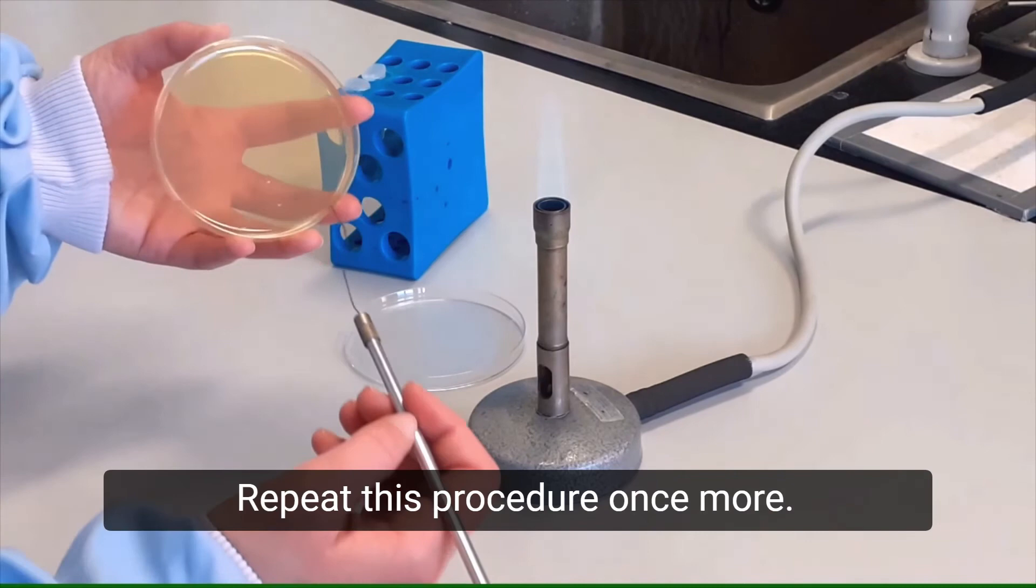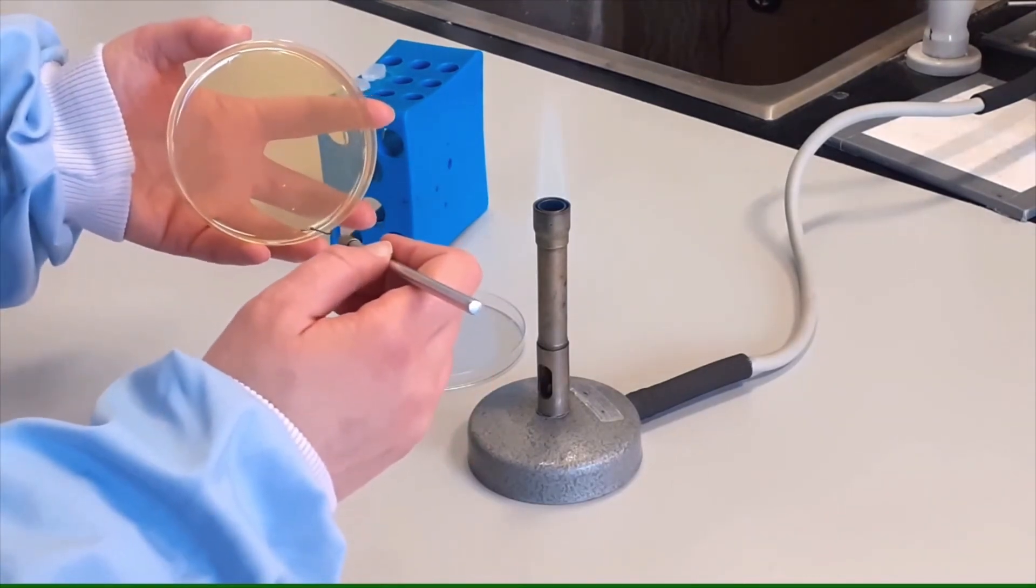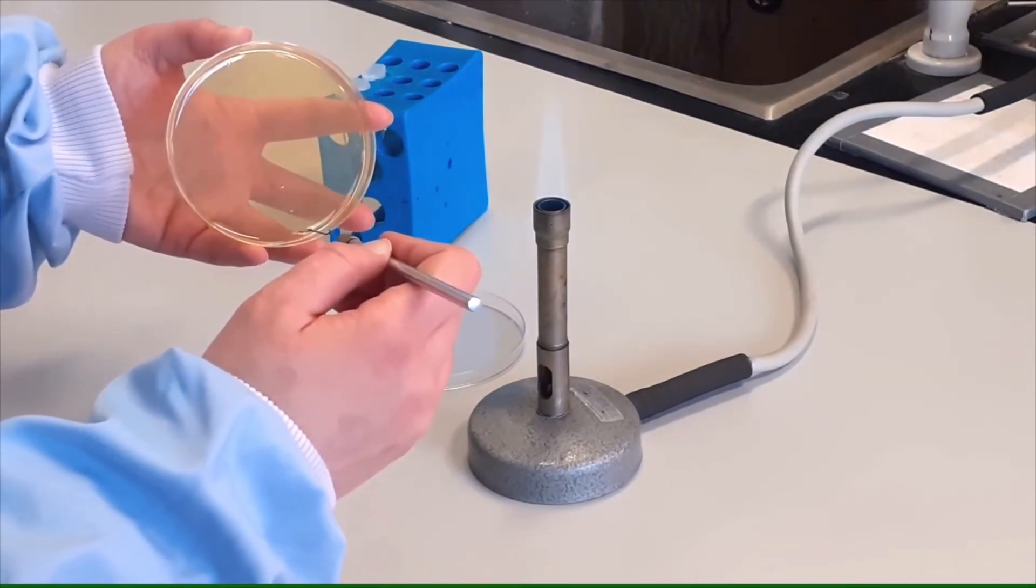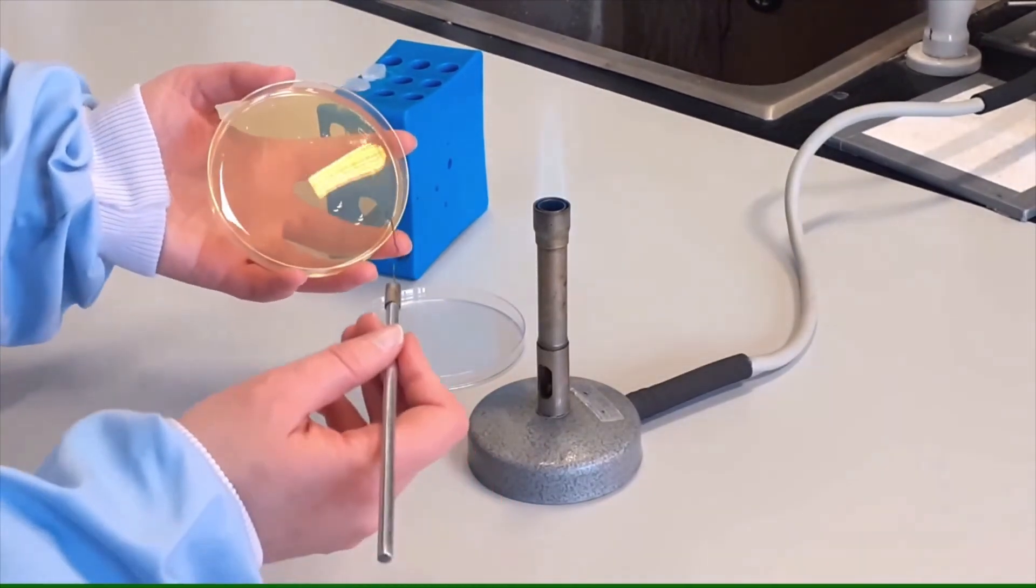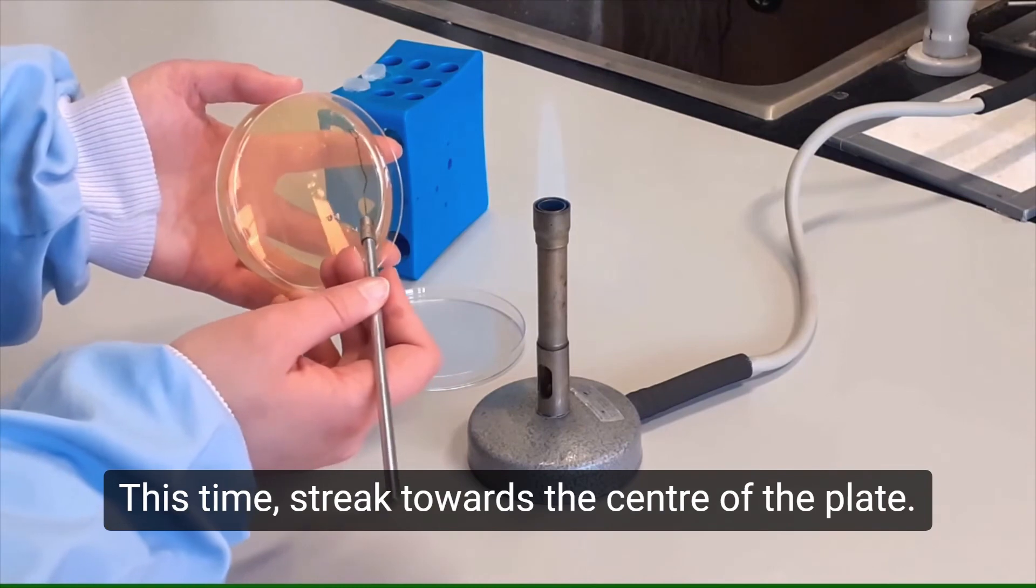Repeat this procedure once more. This time streak towards the centre of the plate.